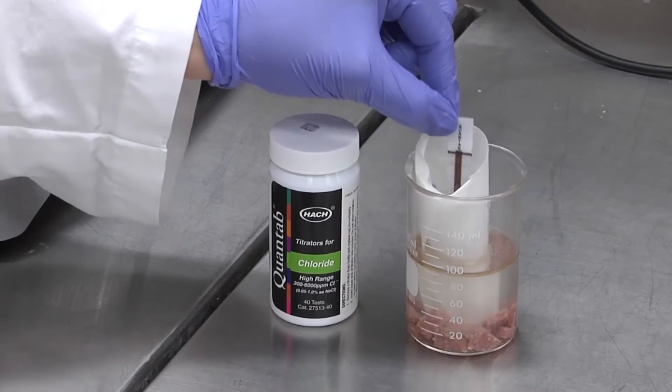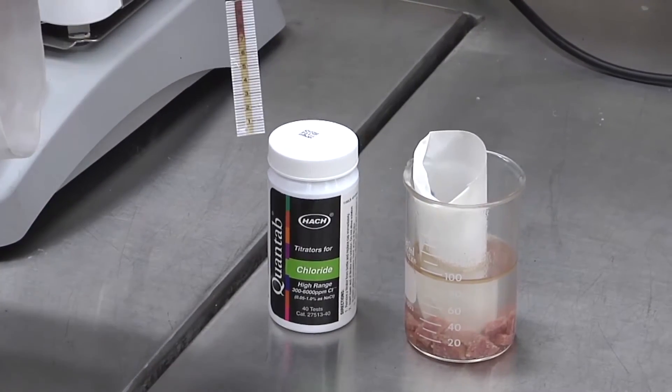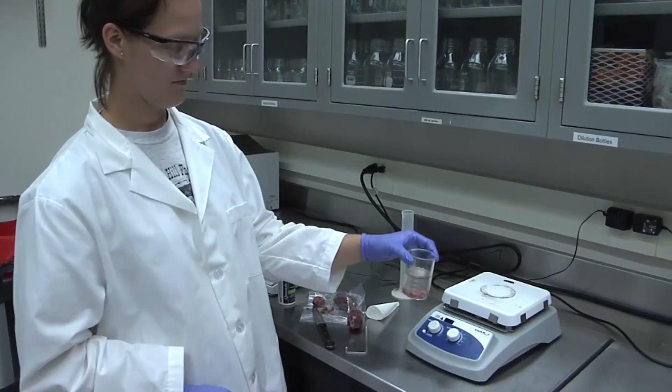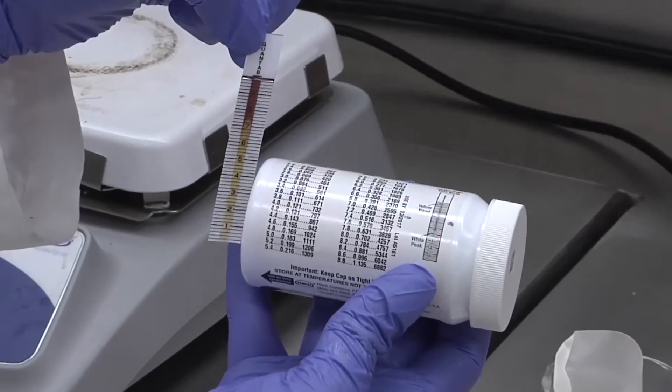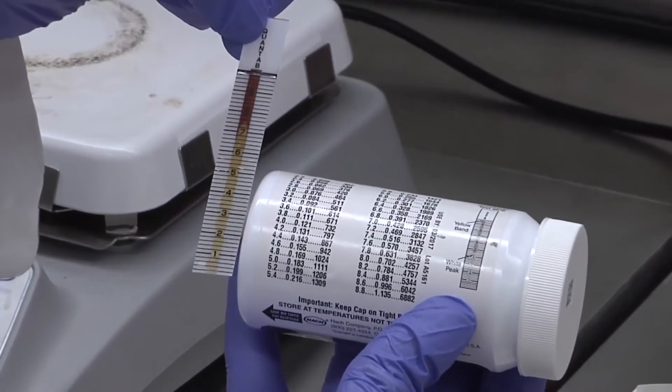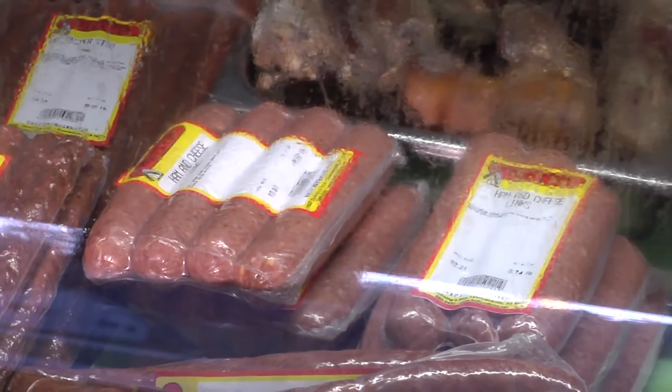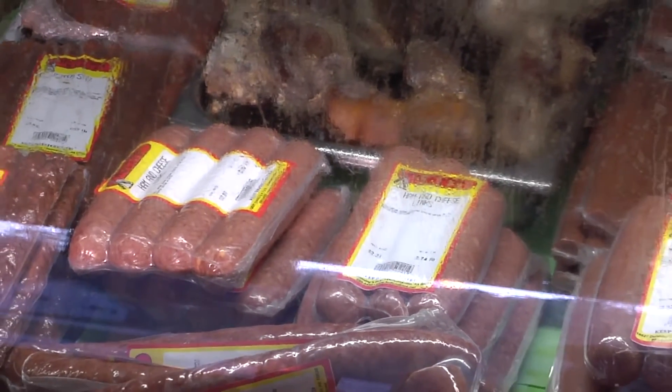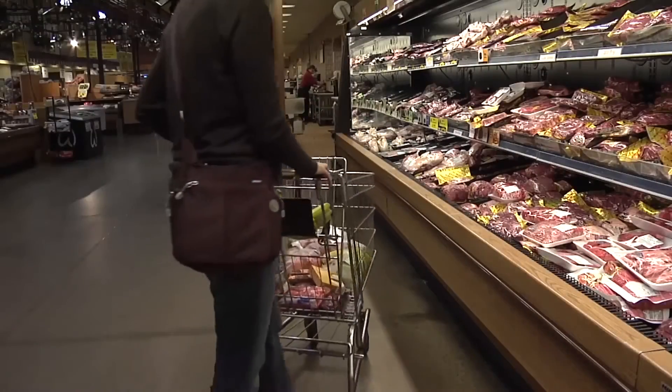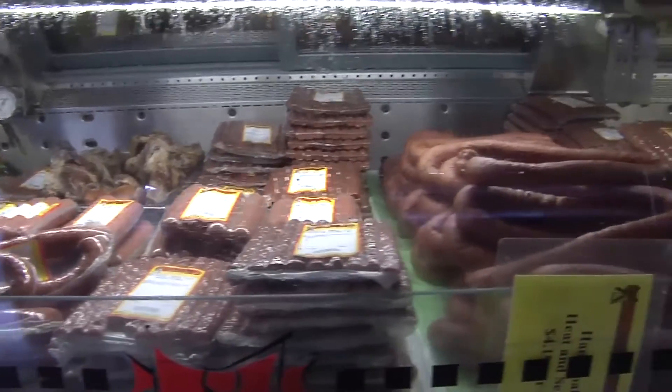This instructional video will teach you how to incorporate rapid quality measurements into your small-scale processed meat manufacturing establishment. Keeping product quality parameters consistent can lead to increased sales by ensuring more repeat business and expanding your customer base through improved brand reputation.